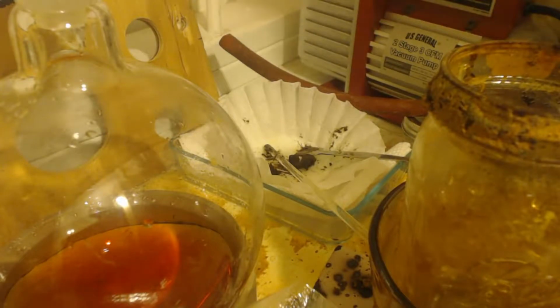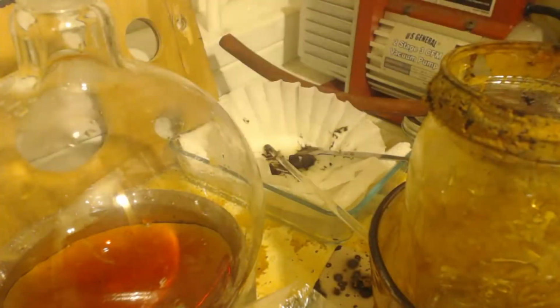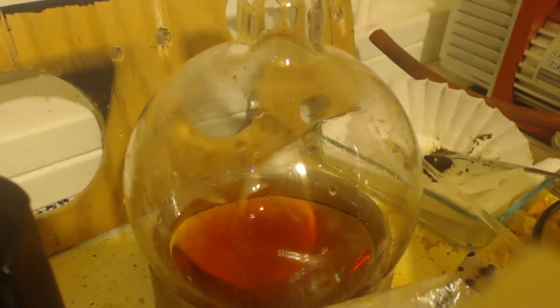Alright, I'm gonna let that dry a little bit. And then this, I got some water here. I don't know if you can hear me. Some sodium hydroxide in there. I'm just gonna set that in there, let that soak it up, clean it up. This, I'm gonna put a cap on it.